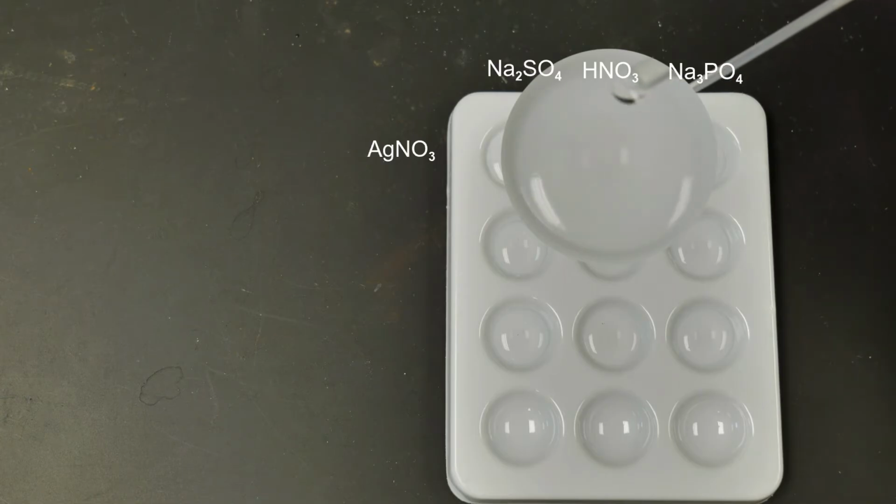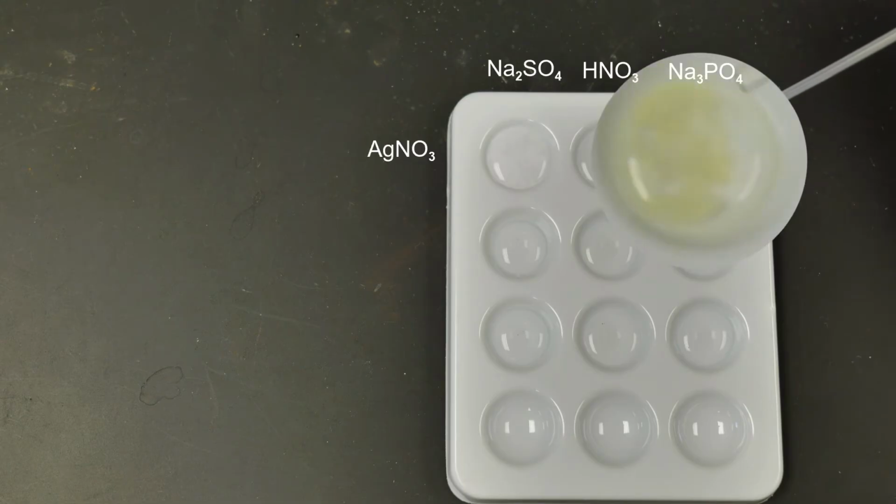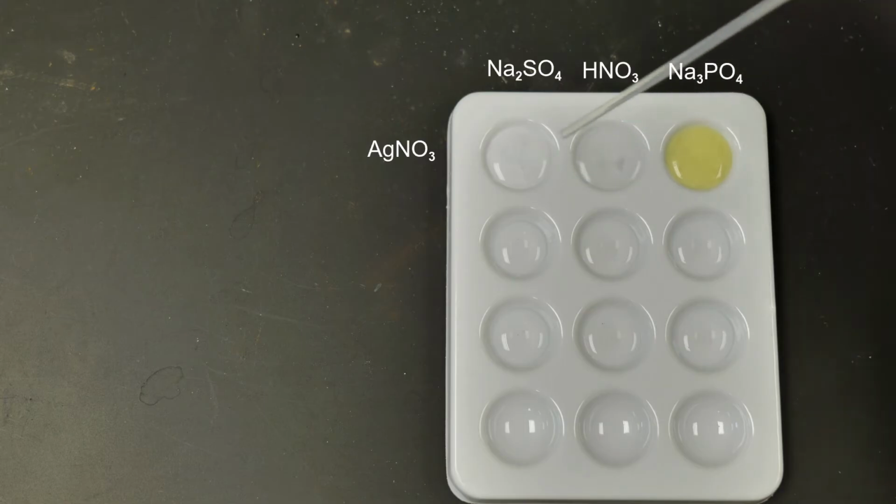Let's add it to the nitric acid. Again, are we noticing anything there? And then let's add it to the sodium phosphate. And now again, are we noticing any change occurring? Make note on your lab sheet which of these 3 wells had a change occur, and we'll move on to the next part.